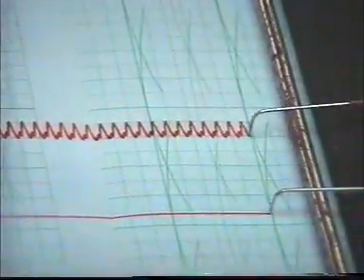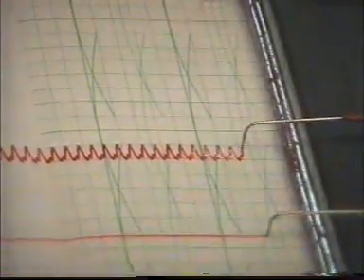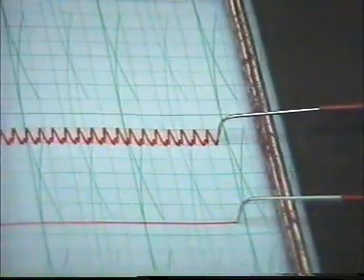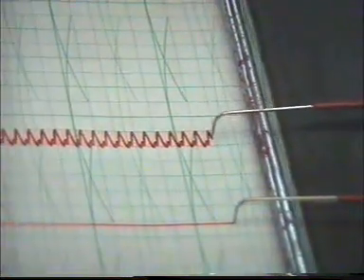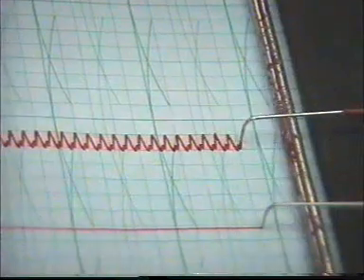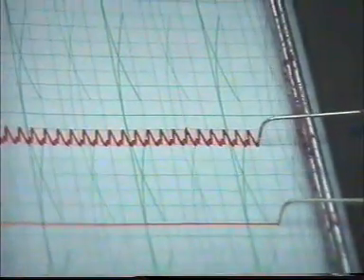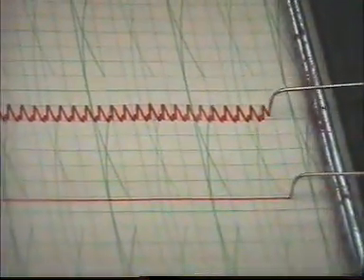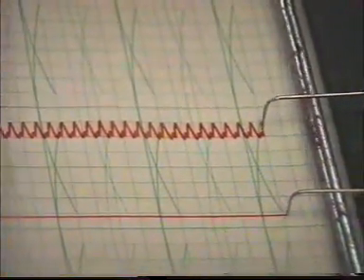The heart block. We are going to block the transmission of excitation from the sinus venosus to the other parts of the amphibian frog heart by tying a thread. We call it Stannius ligature, between the sinus venosus and the atria. As you see here, this is the normal recording, but after we tie the thread, you will see the block of transmission of excitation, and the heart will stop. The only part beating will be the sinus venosus, and after a time, the other chambers resume beating.